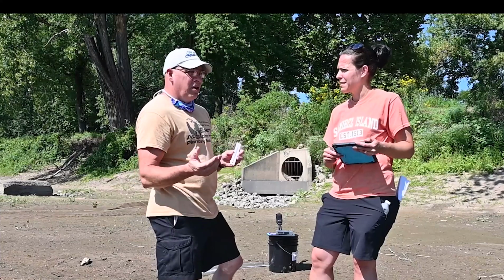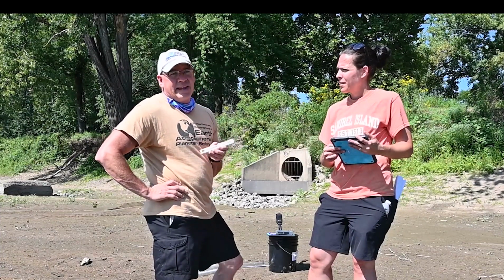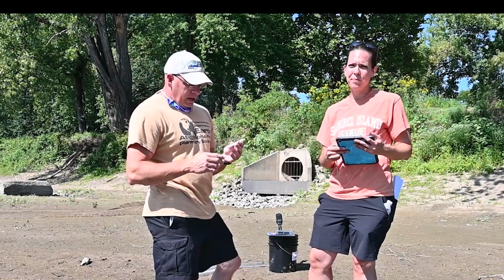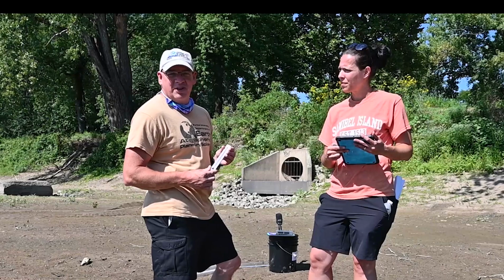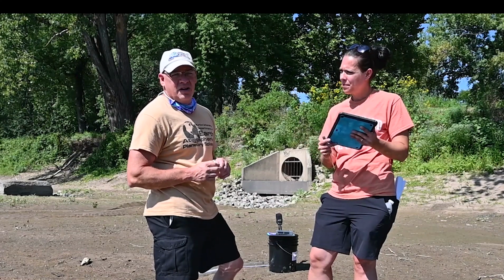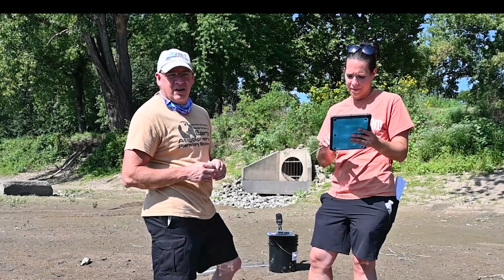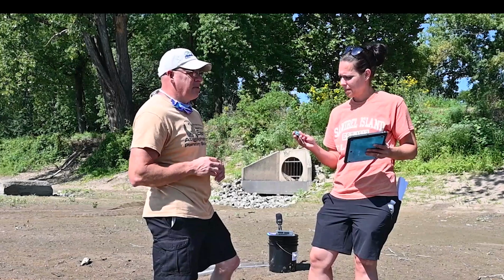As for taking your data collection, you can use the alcohol-filled ones, but you need to calibrate them. I did not calibrate this one, so I'm not going to be able to use it today because we really don't know what the actual measurement is. So we're just going to take our temperature with Sarah's, the digital one. We've calibrated all of those, so we know it's calibrated correctly, and we're just going to use that one today.